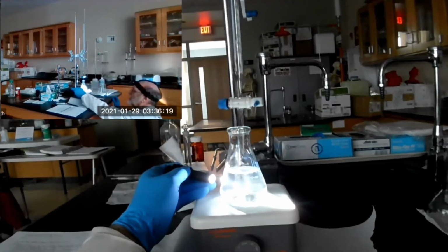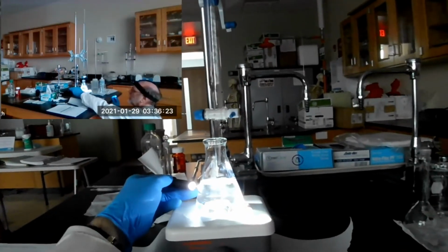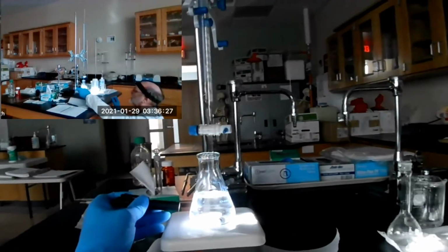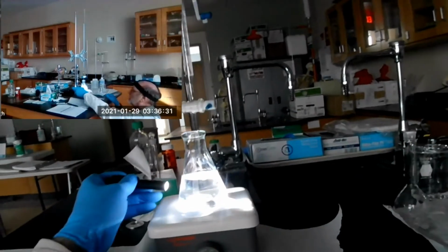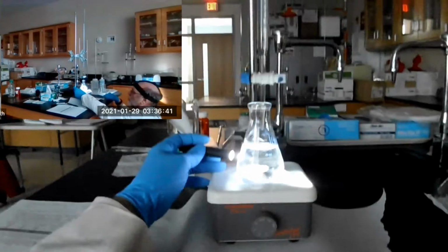Okay, is it going to go away? Still working on it. You can see it from this angle. Yeah, there we go, it's gone. Now what I'm seeing is reflection on the glass. I'm not seeing the light beam. Okay. Hope you can see it from there. I know it's probably not. The head cam hopefully will get it.